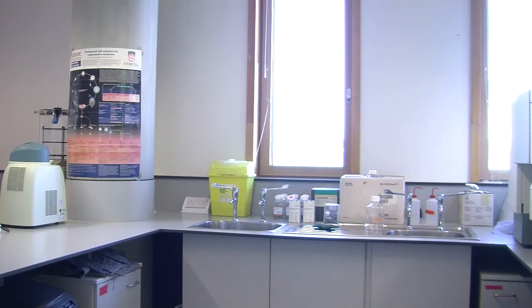Yeah, that's fine. That's okay. We like that. Yeah, we want to go a bit more, just a little bit up here. Okay? Then just leave it a little bit. Good. Very good technique. That's it.